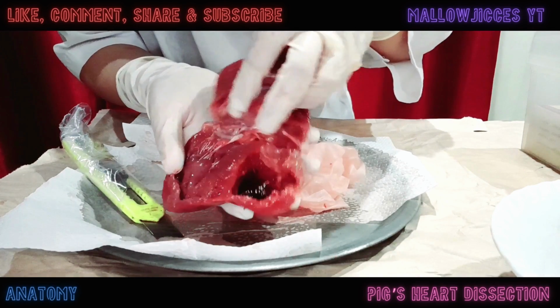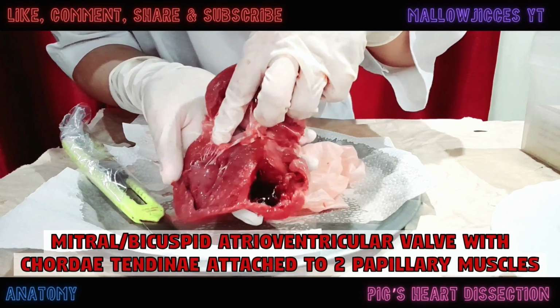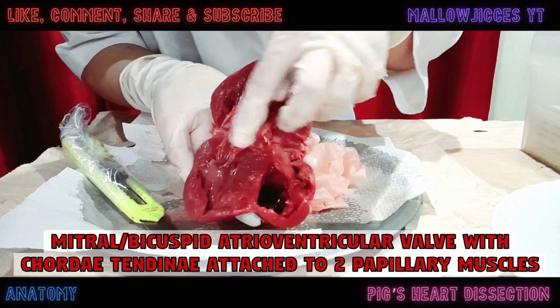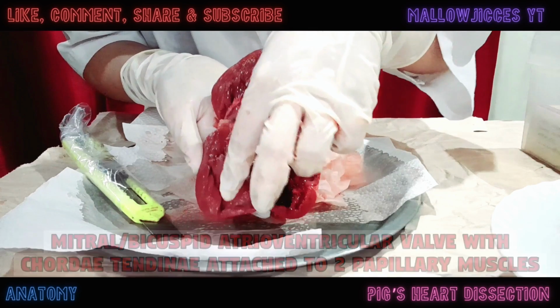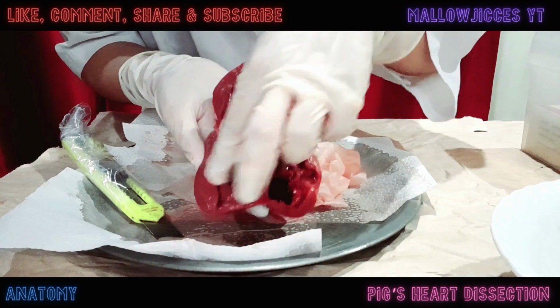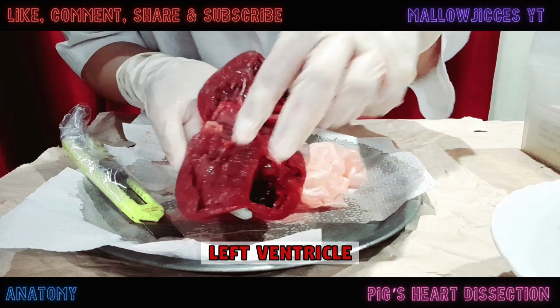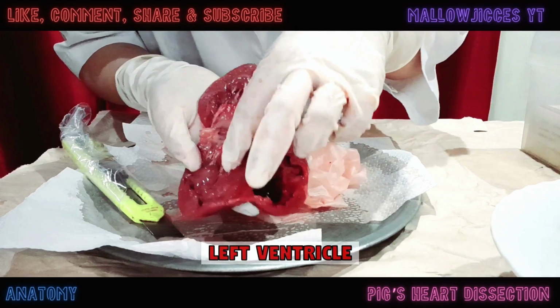Then, it will go through the mitral or bicuspid valve with its own chordae tendineae attached to the 2 papillary muscles within the left ventricle. From that, blood will go into the left ventricle here, which has a thicker muscle or myocardium than the right.